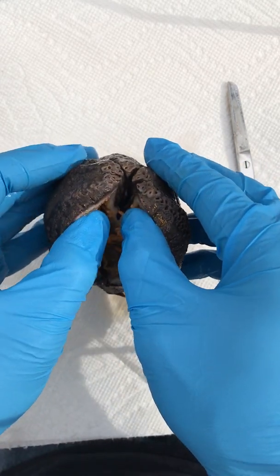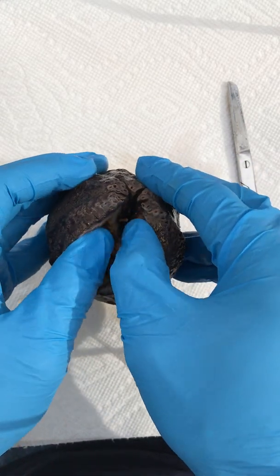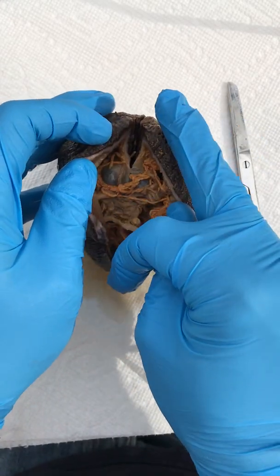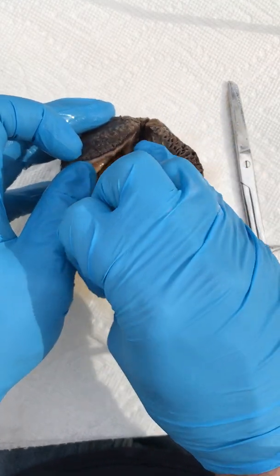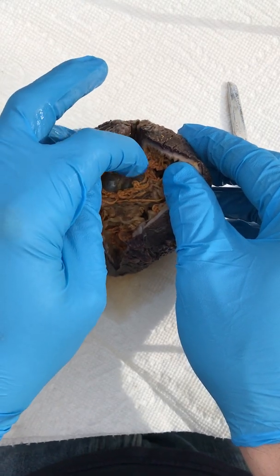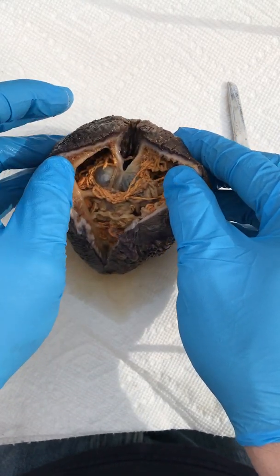It does have tentacles, but when they're preserved they tend to invert the tentacles into the pharynx. I've made one incision initially. You see where my finger is there? We have the beginning of the GI tract — the pharynx there — this muscular part here.